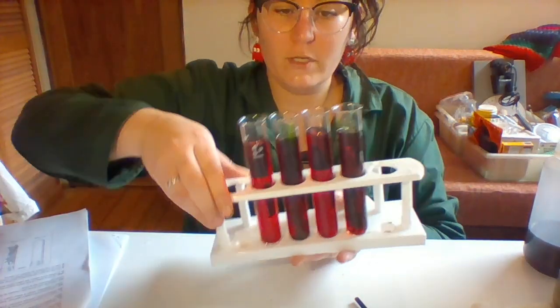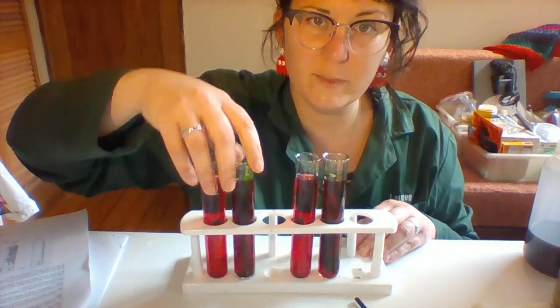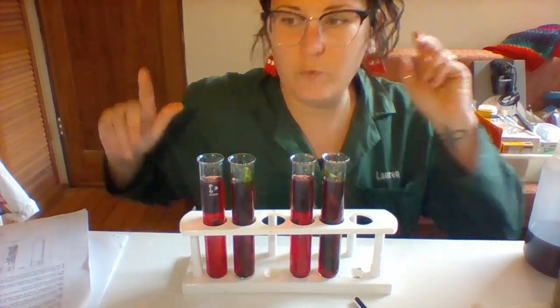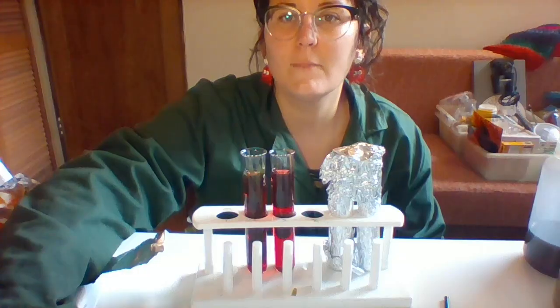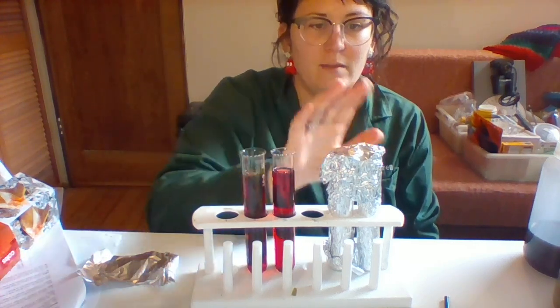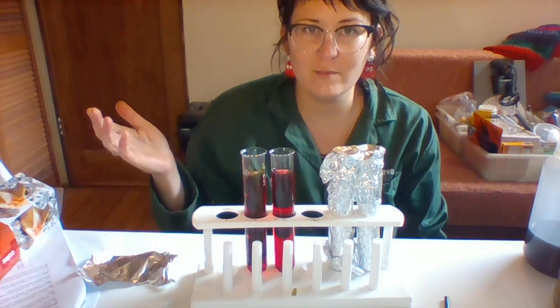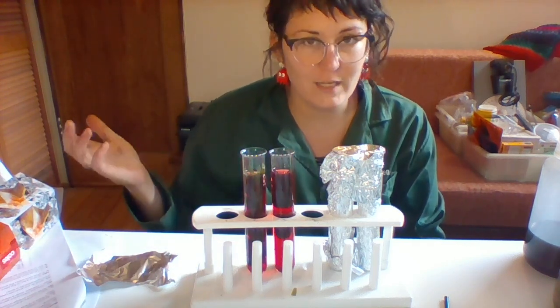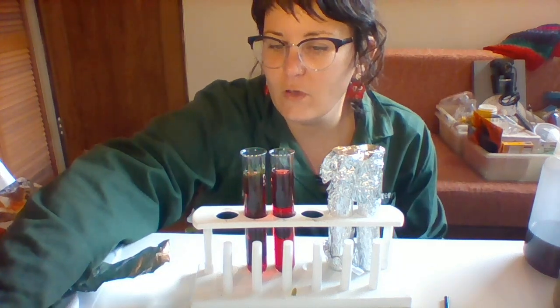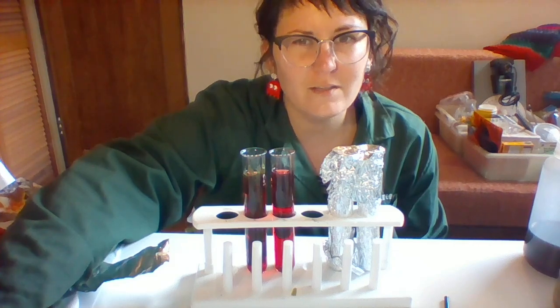So now I'm going to put one set of these in the sun. I'll put it outside probably, and I'll put the other set in a cupboard. I might cover it in foil. Voila! All right, we're ready to go. These guys are going to go in the sun. These guys are in darkness, so you can hypothesize about what gases you think they're going to create in each of these scenarios. And I will show you the results maybe in like 5 hours.